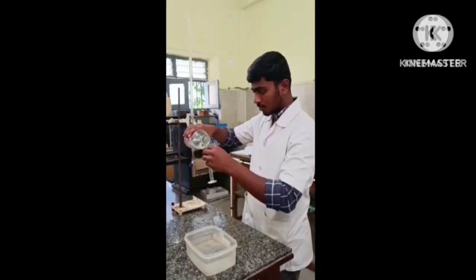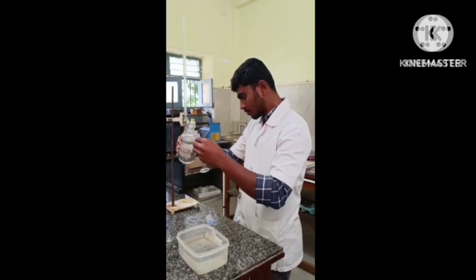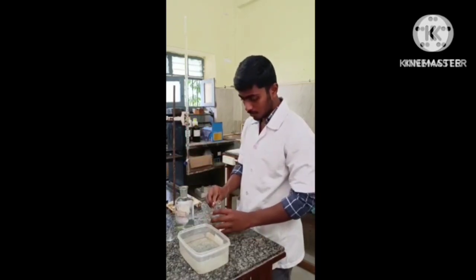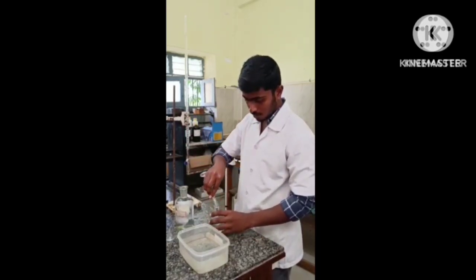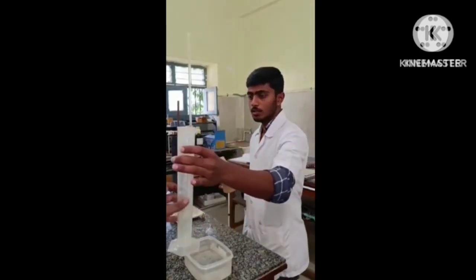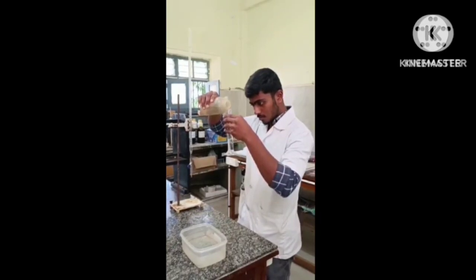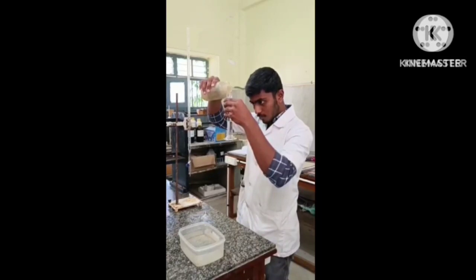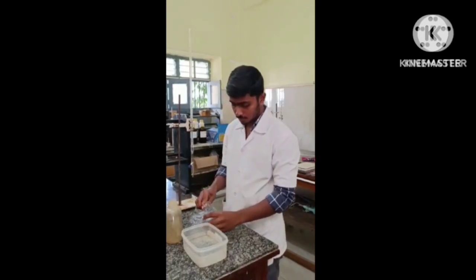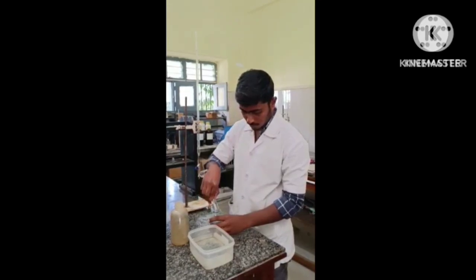After adding oxalic acid, take 10 ml of sulfuric acid using a standard measuring cylinder and transfer it into a reagent bottle. Then take 25 ml of distilled water in a standard measuring cylinder and transfer it into the reagent bottle, which is already having 50 ml of oxalic acid and 10 ml of sulfuric acid.